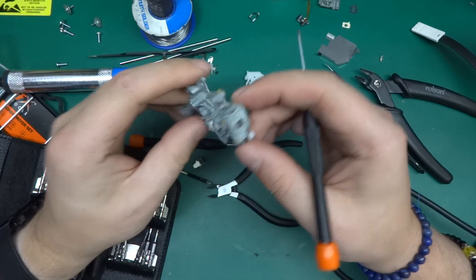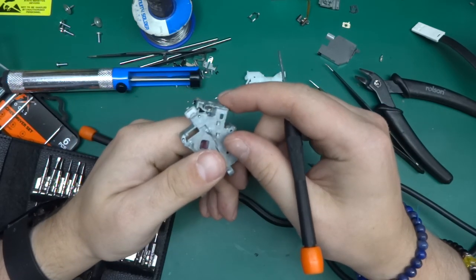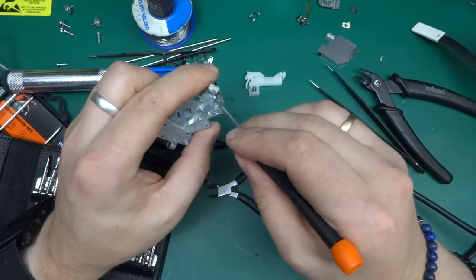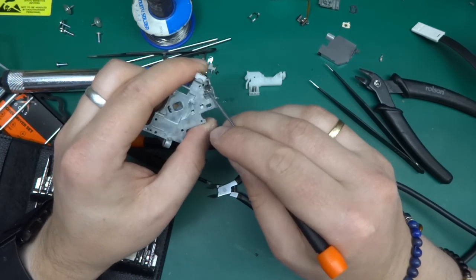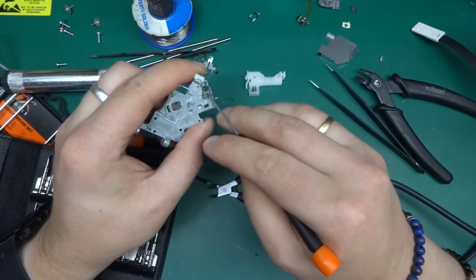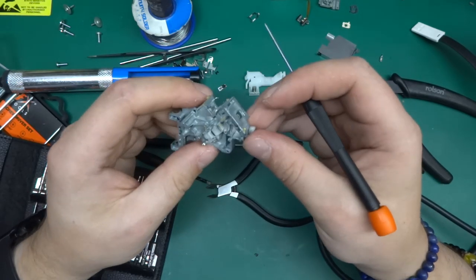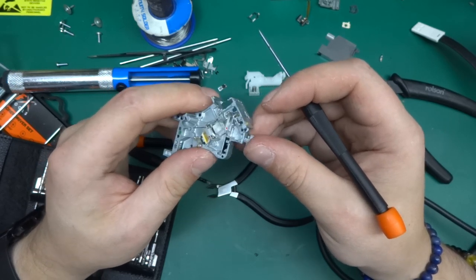There we go, that's another one. And now this is the tricky part. I don't want to get you scared, but this is where stuff can go horribly wrong, because a lot of this stuff is glass. So there have been occasions where I've applied too much pressure and I've cracked one or two items.